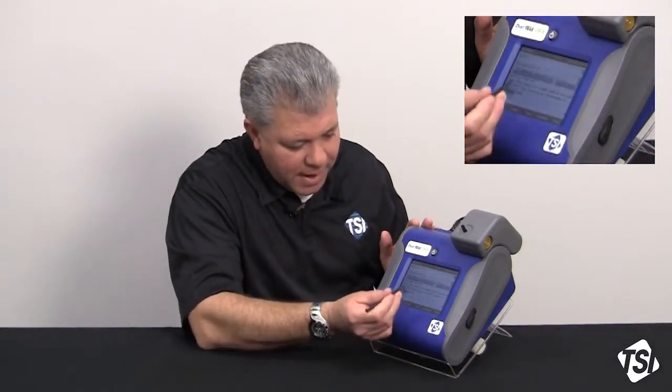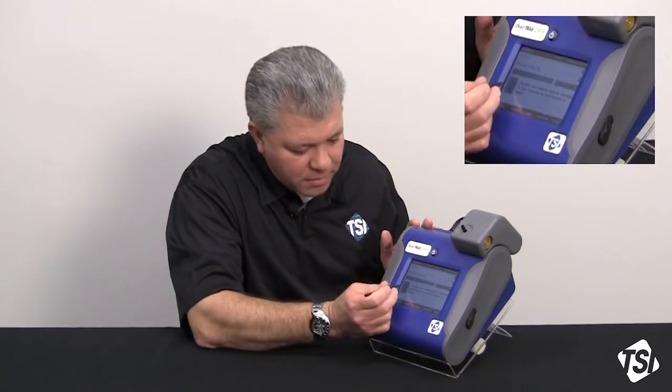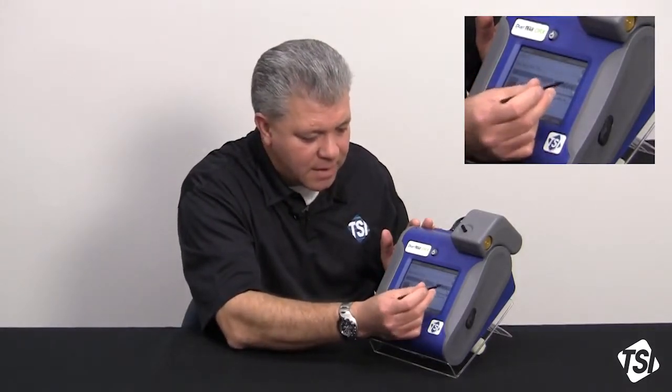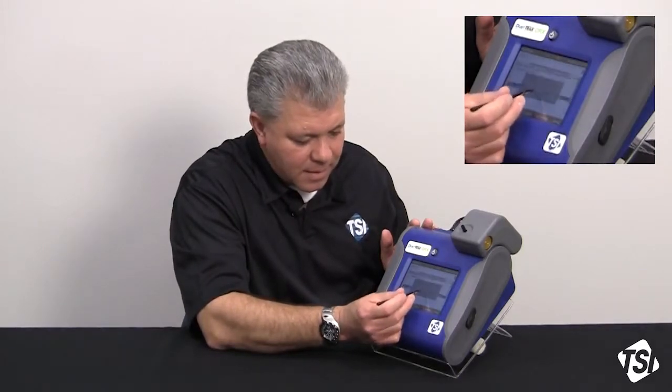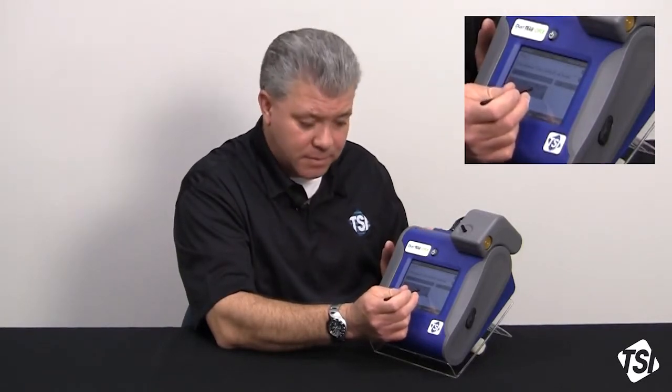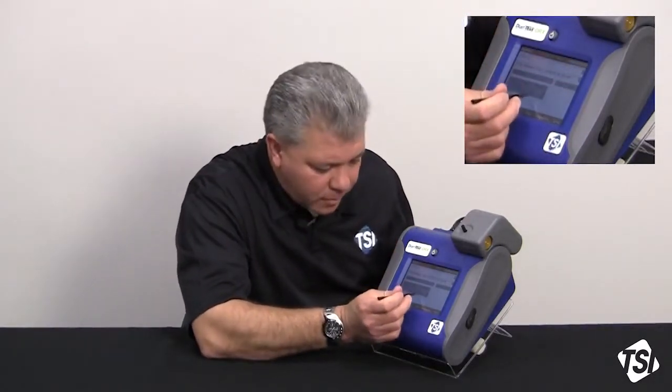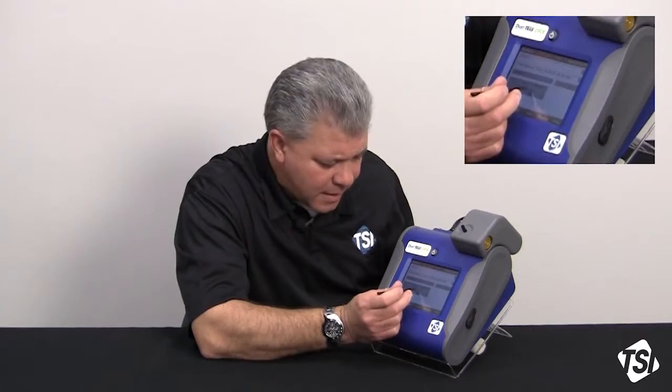I'm going to select that, toggle the down arrow key to turn it on, and save that. Then it's going to reset the logging interval to 2 minutes. Now I can have more than 2 minutes, I just can't have less. So it wants me to set that.